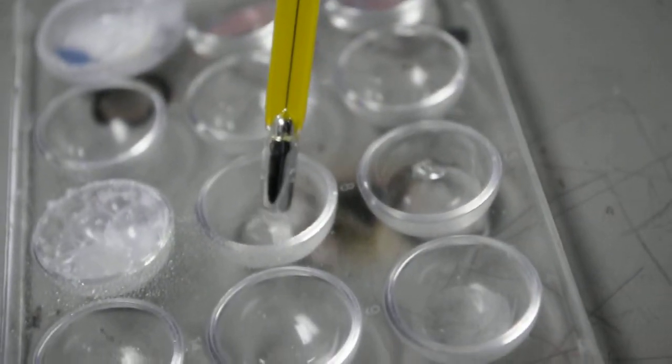No, it's below 40 now. Yeah, you're about 38, 37. Okay, so that magnesium got the water warmed up a little bit too, didn't it? Yeah, sure did.